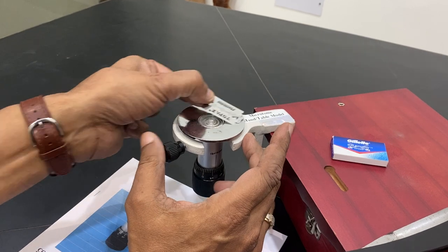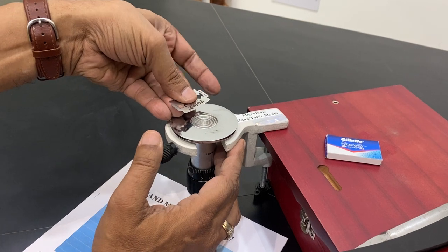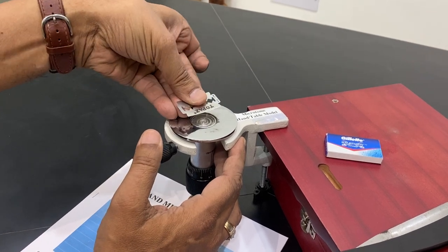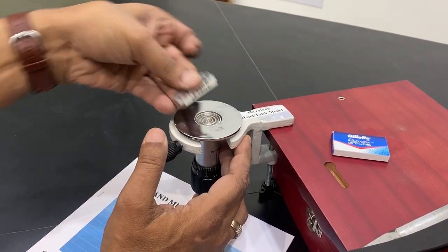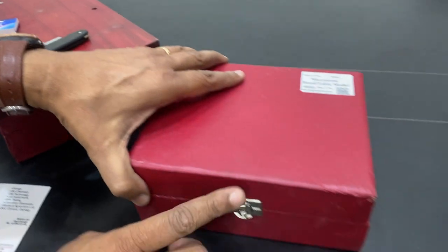Movement from here to the side. Or if the sample is above it, you can cut the sample in this fashion also. Very easy to use. And then these are microns. Keep it — it comes in a box like this.